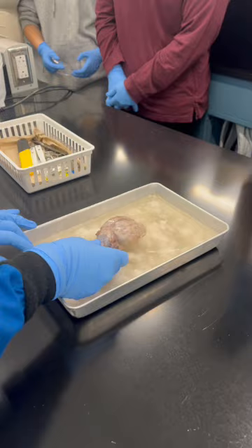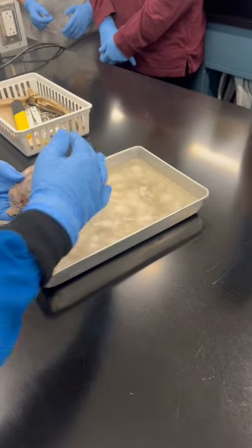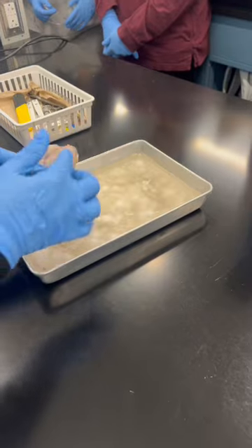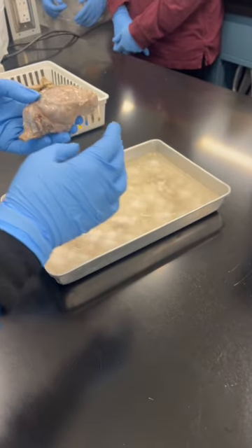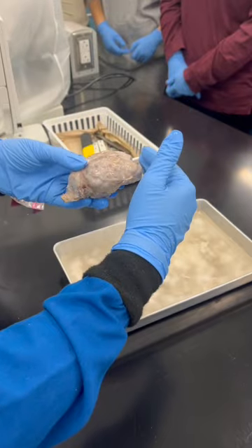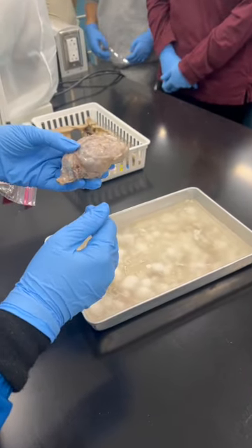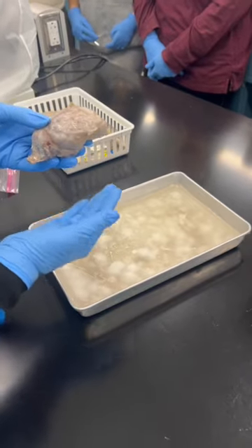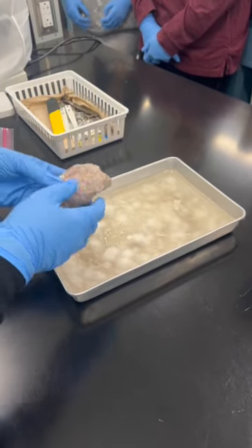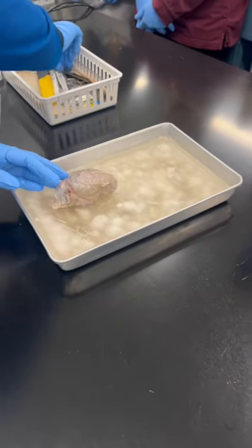What is this? What I say we're going to dissect? Sheep brain. What is the anterior portion of the brain? Can you see this one? The sheep is standing like this, so this is anterior and this is posterior, but also dorsal and ventral in that sheep. The brain structures are almost the same as what we studied in the human brain.